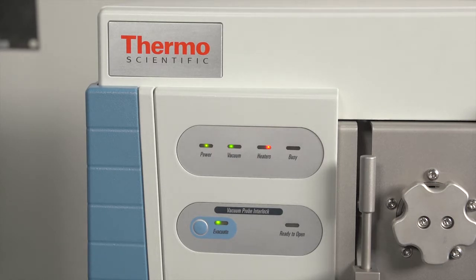...the vacuum light becomes green. The heater light will turn green once the ion source and transfer line reach their set values.